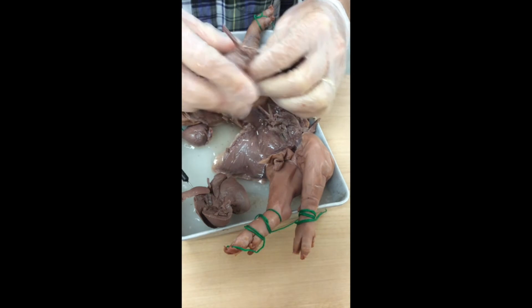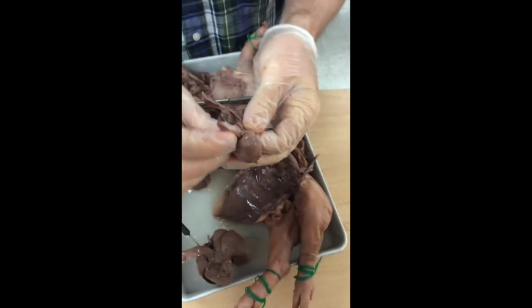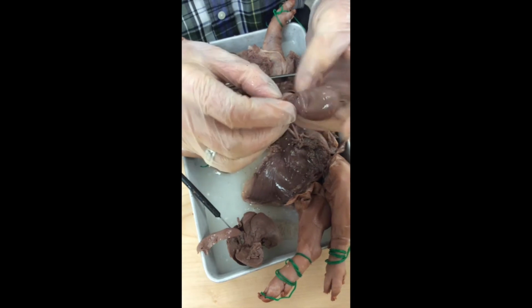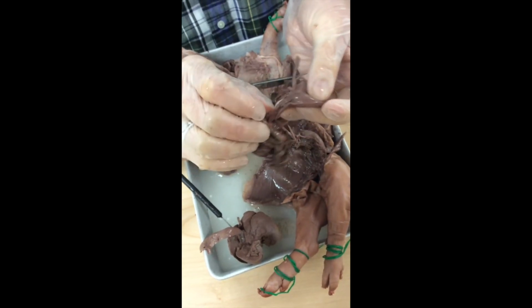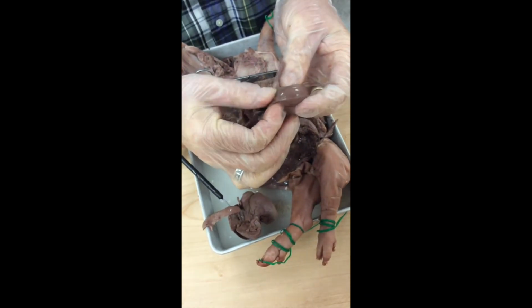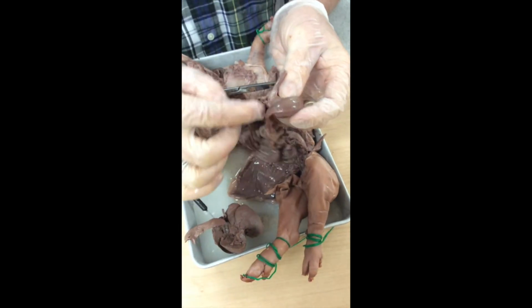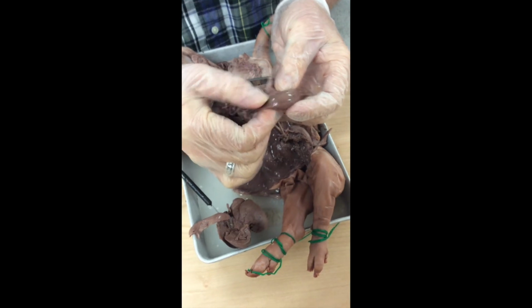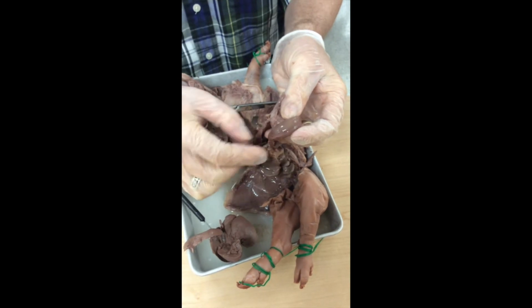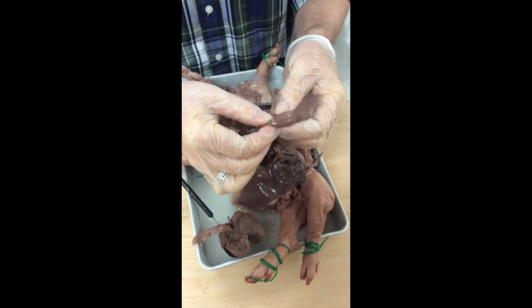Now, something I want you guys to do, it's so cool. You can see right here, there's the esophagus attaching into the stomach. Now, you would also notice at the other end of the stomach, it attaches into the intestine. I want you to feel, squeeze in this area right here. And when you do so, you're going to feel that it's pretty rigid, pretty tough. We have a circular muscle there called a sphincter muscle, the pyloric sphincter, and it controls movement of stomach contents on into the intestine. Stuff doesn't just go in the stomach and flow right through. We need to have a door open for it to go.